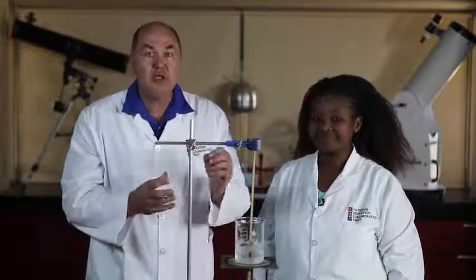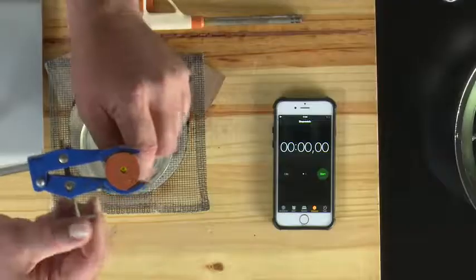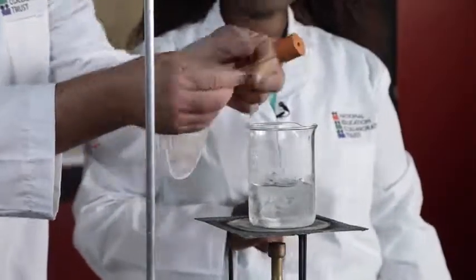We don't need to take the thermometer out of the water at any stage of this investigation, so we're going to clamp it into position. So here's the retort stand and a clamp to support the thermometer in the beaker. Push the thermometer through a one-hole cork or rubber stopper.